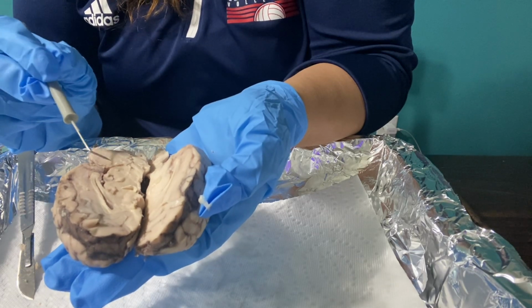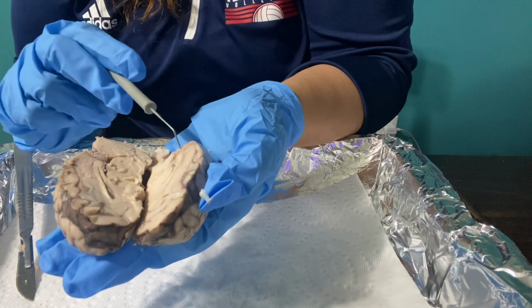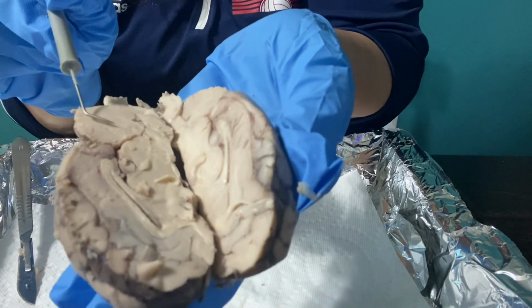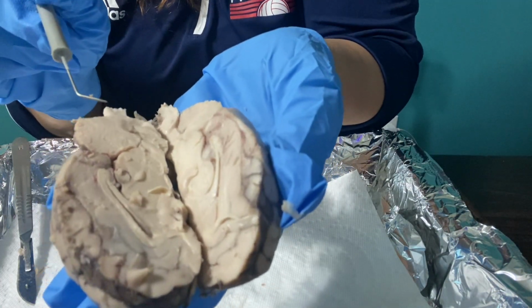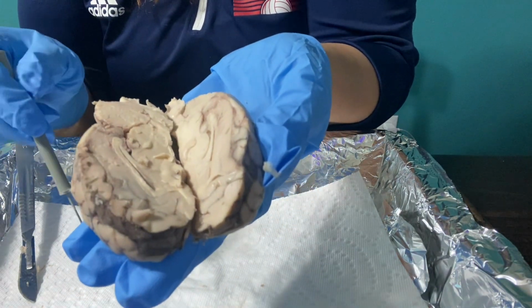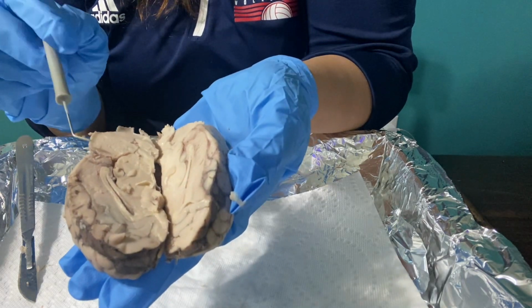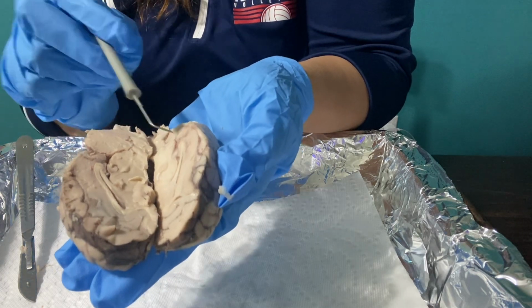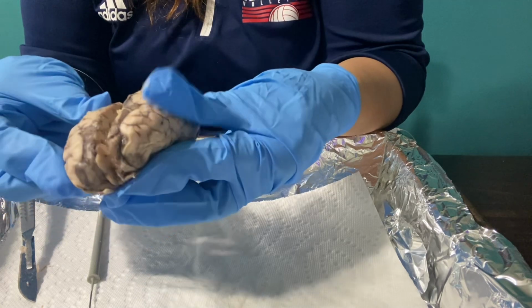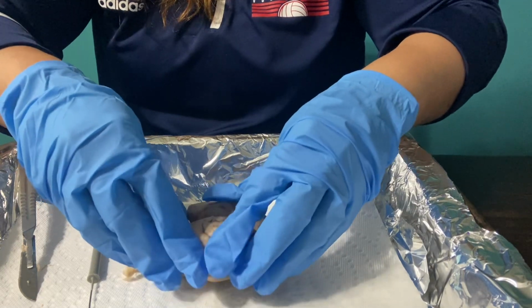And then right around here is the pineal gland, which is cut in half, as you can see, and is responsible for producing and regulating hormones, for example melatonin. When melatonin is produced in the body, it helps regulate the sleep-wake cycles, and it plays a very important role in maintaining the body's circadian rhythm for resting as well. So that was my brain. I'm trying to see if there may be some other areas I can talk about. So let me put that back together.